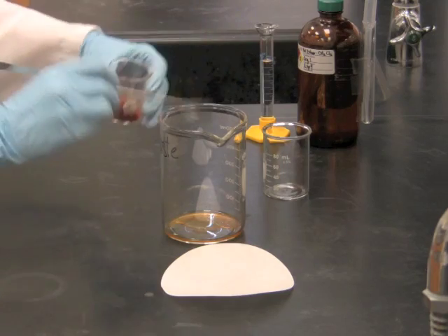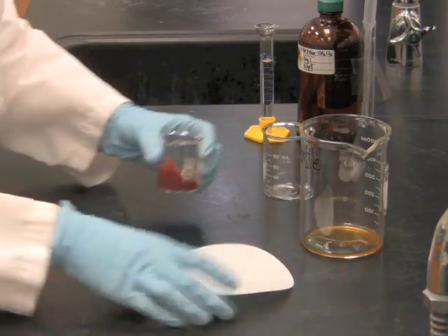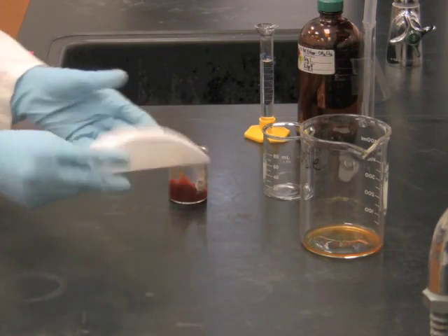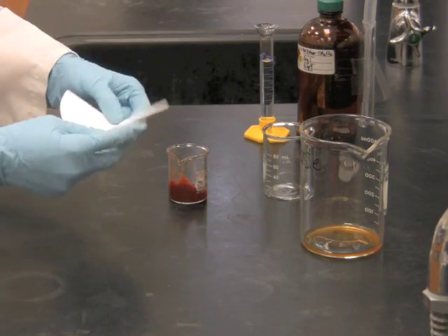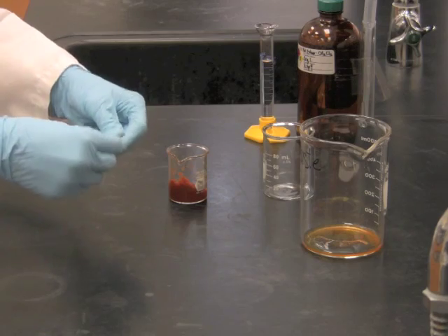To get the last bit of liquid out, you're going to put the tomato paste into a piece of folded filter paper and squeeze it.